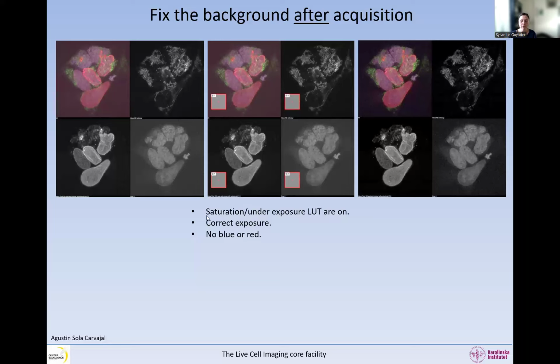So we keep the saturation lookup tables on. We use the correct exposure. There's no red and there's no blue. Right now in this image, the saturation and underexposure lookup tables are on, but you don't see any blue or red because it's correctly exposed. And then afterwards, we're going to subtract. So to acquire images without underexposure on single point confocal, this is where I said there is a risk with the underexposure.